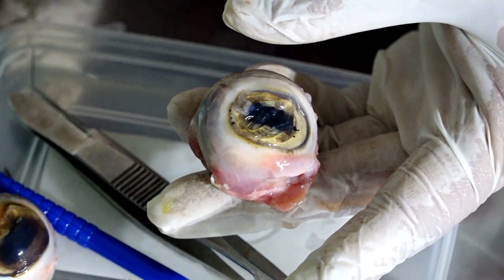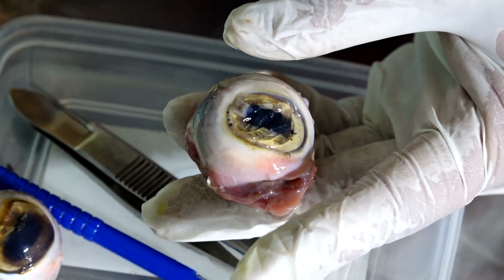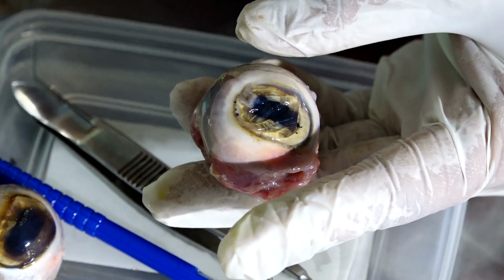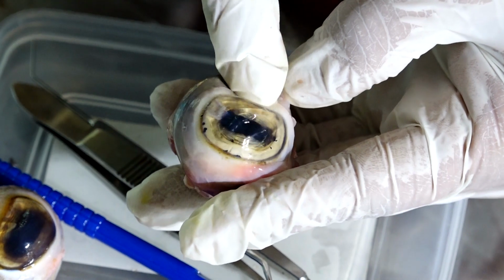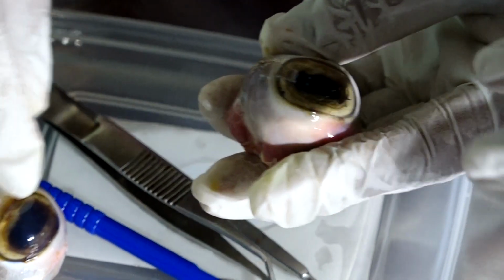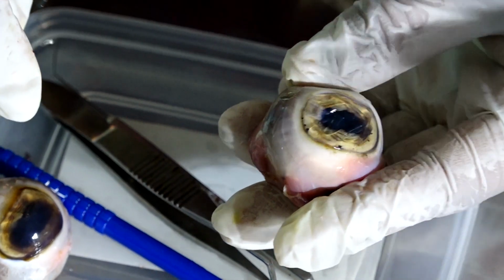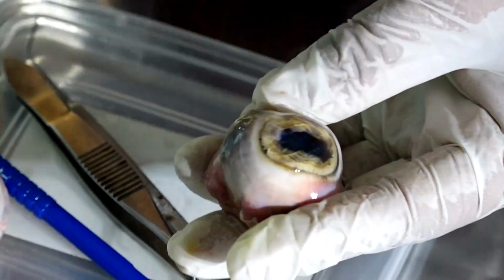This is what happens in injuries. In injuries, when there is a full thickness entry into the eye, the aqueous comes out. And when the aqueous comes out, the eyeball is very soft and you can actually feel it. It's very, very soft. Okay? Yeah, please do. Is it soft? Yes.